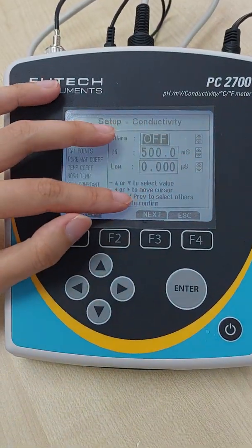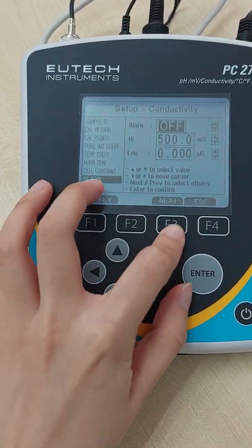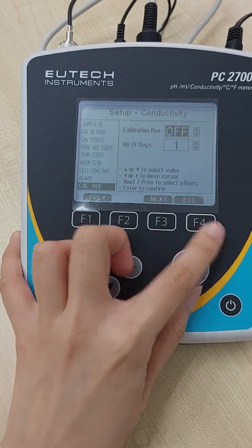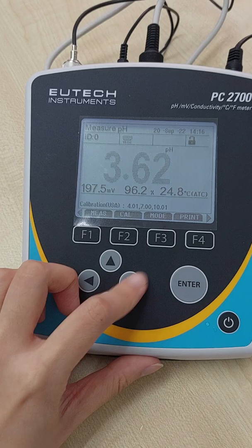Alarm is the same. You can set your range. So if it's out of range, it will give you an alarm. Cal due, same as well.